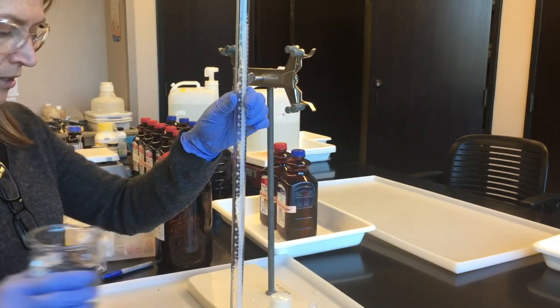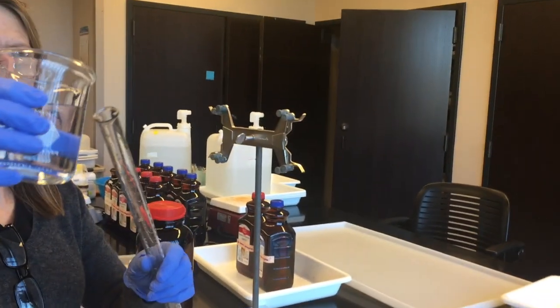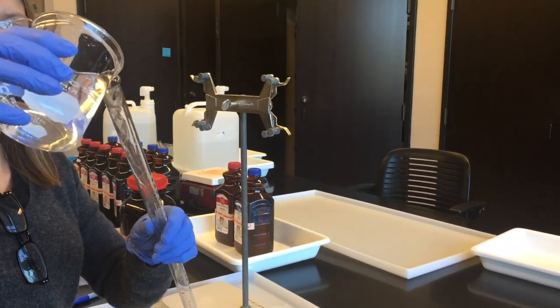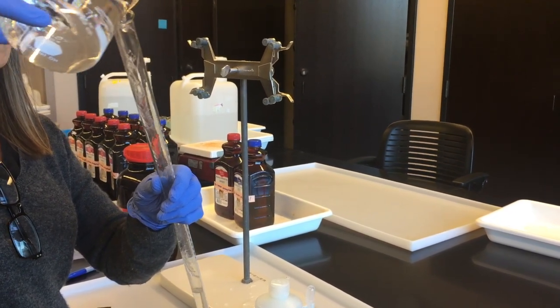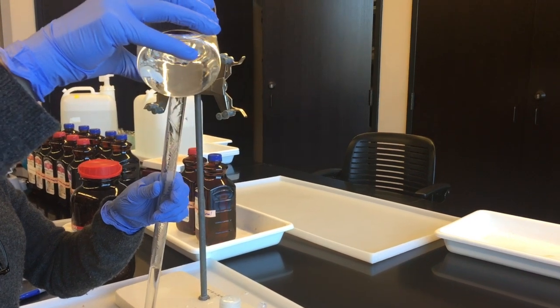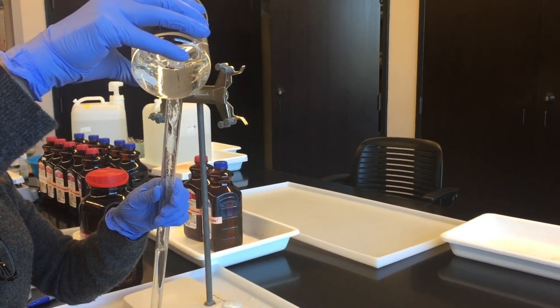And then you're going to get some deionized water. And now you're going to fill the rest of the tube slowly and carefully keeping it over that tray with water.